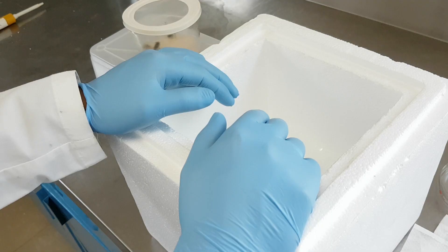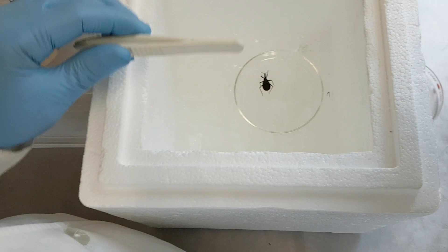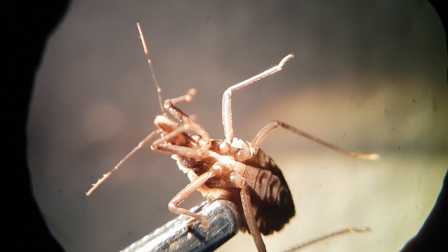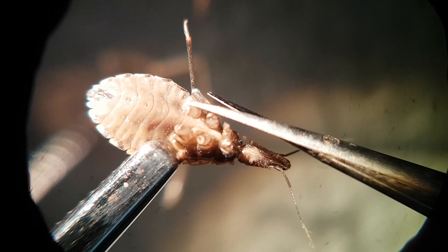Gloves will be used throughout this video. Always keep safe. Place a kissing bug three to five minutes on a petri dish on ice to anesthetize it. Bring the bug to the dissection microscope and hold it carefully with soft tweezers on the edge of the abdomen. Using fine scissors, cut the legs off from one side and then the other.